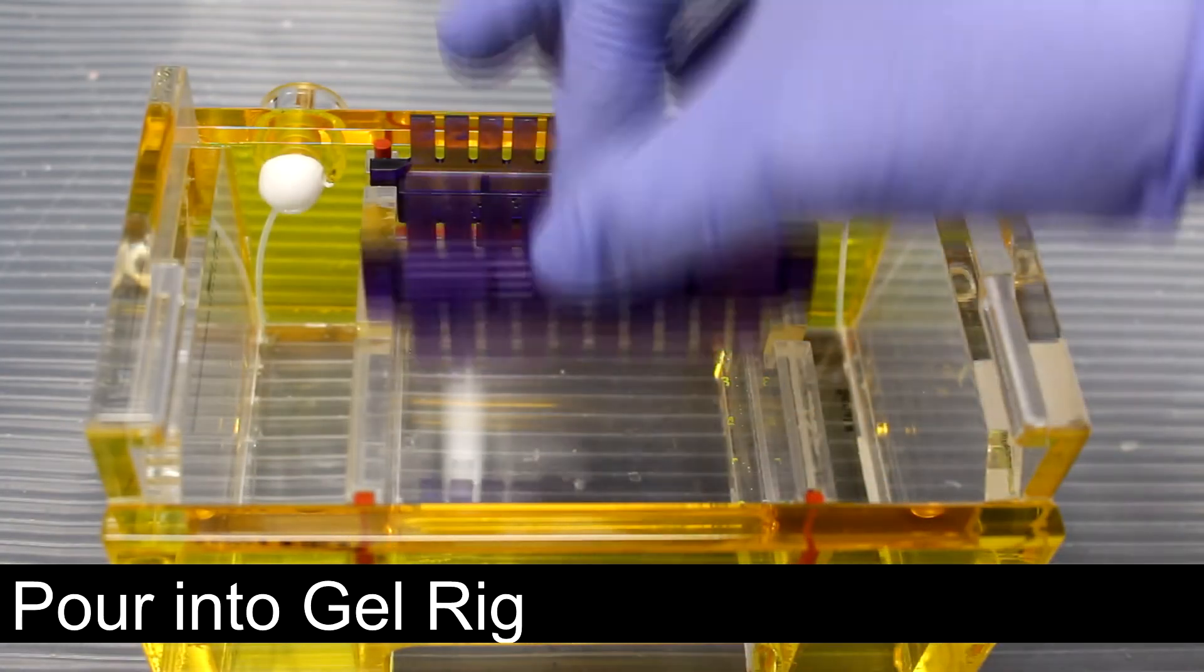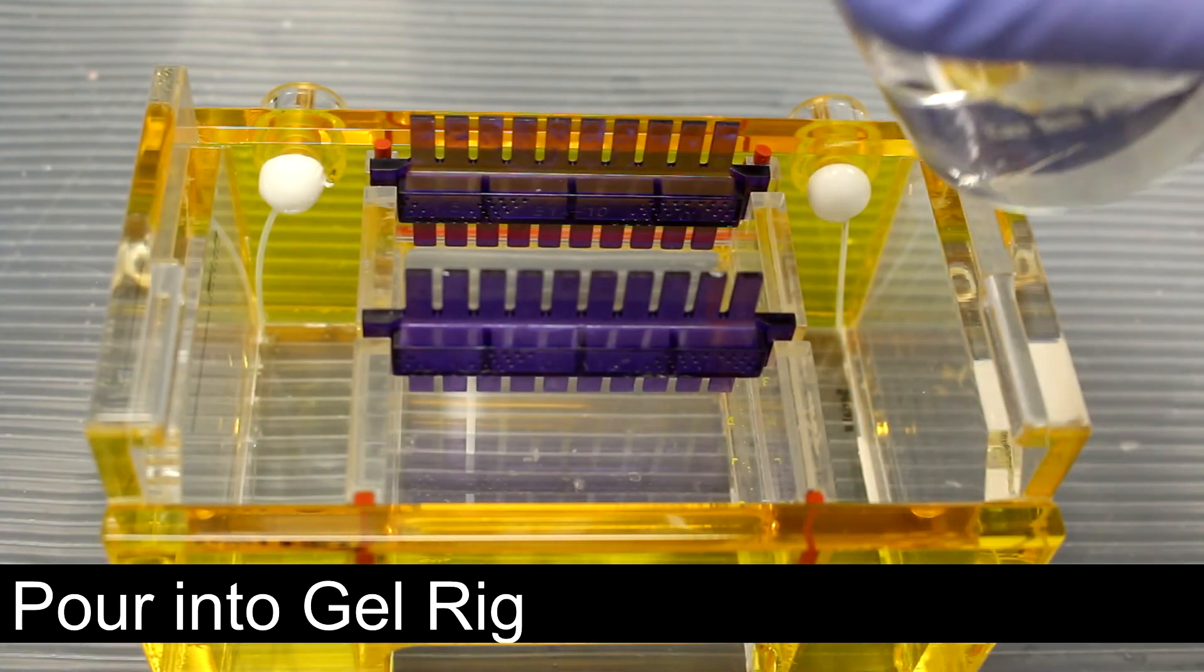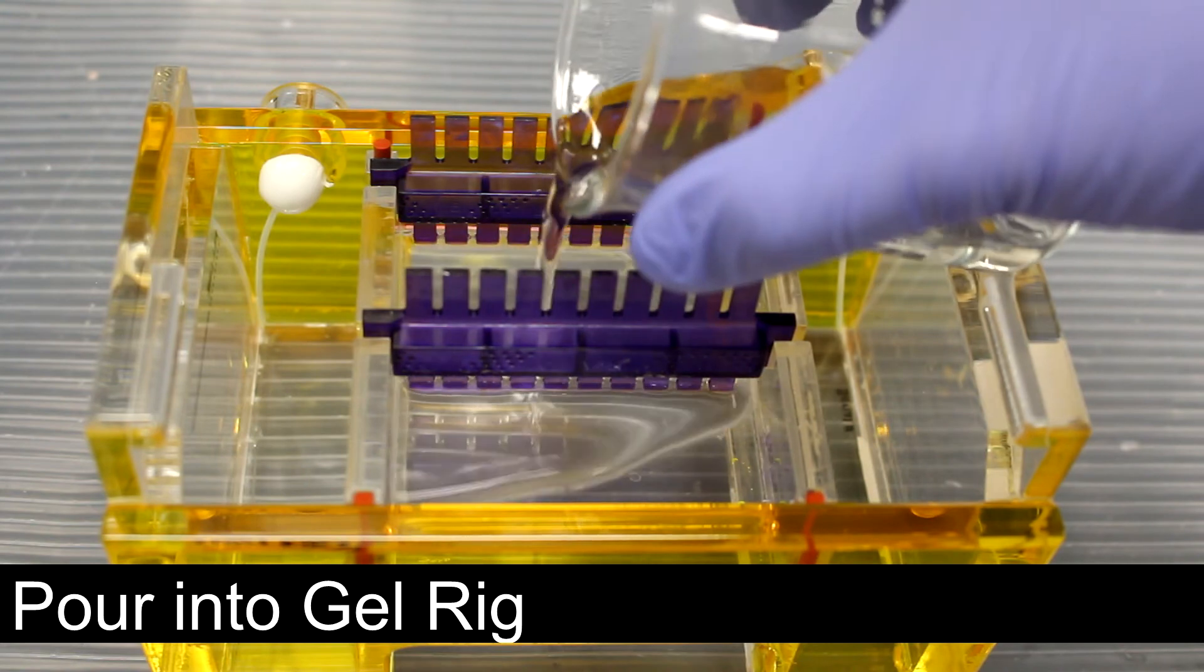The two combs are attached. The agarose solution is poured into the gel rig and the gel left to polymerize.